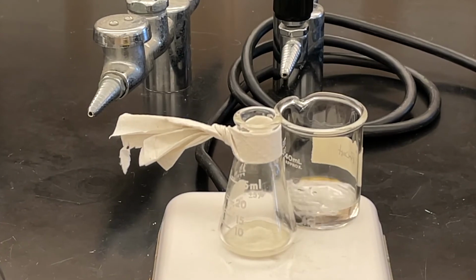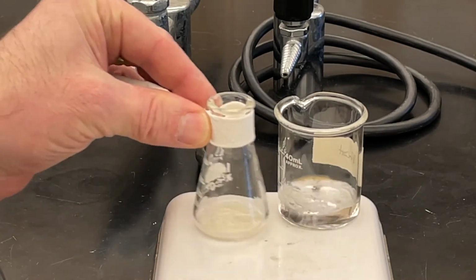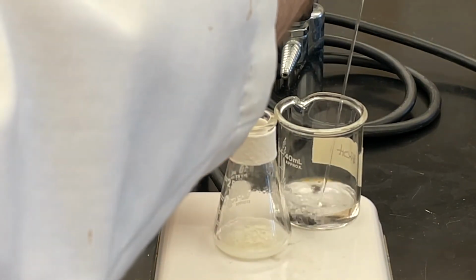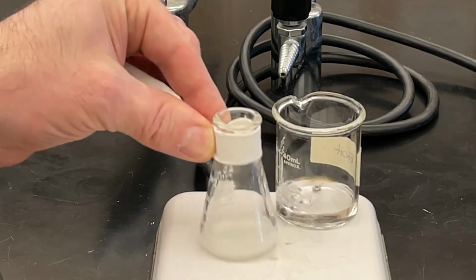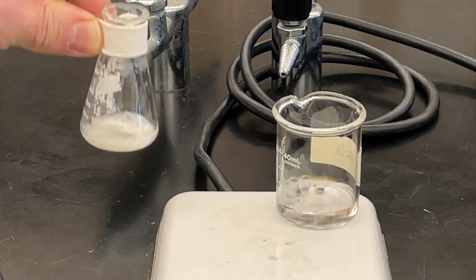Now, as that comes to boiling, this part happens fairly quickly. What we do is we give it a little bit of agitation and then fairly quick transfers, about a half mil every 10 seconds, until we just dissolve everything at the boiling point of the solvent. So everything needs to be kept hot. If you get some frothing, you can take it off and see where you're at.